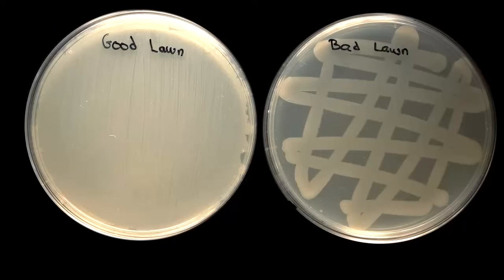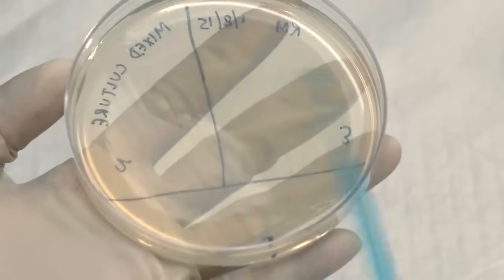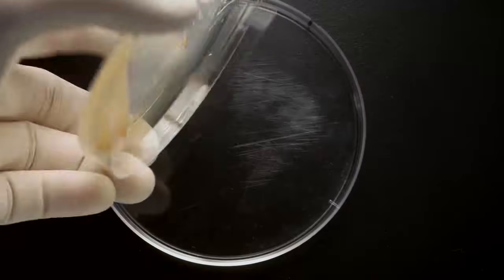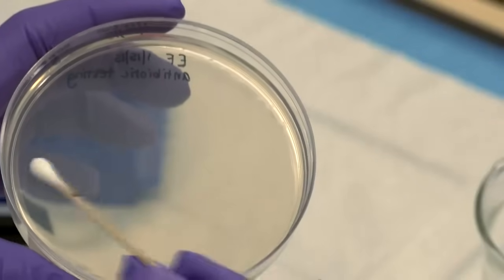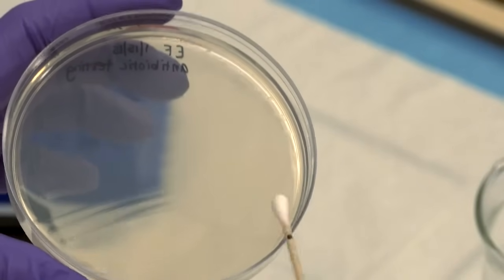Let's put them on an inoculated petri dish. For this petri dish, we'll grow a lawn of bacteria. Last time, we streaked out the bacteria to get individual colonies. This time, let's cover a whole plate with a thick layer of bacteria. The bacteria grows up into a lawn.